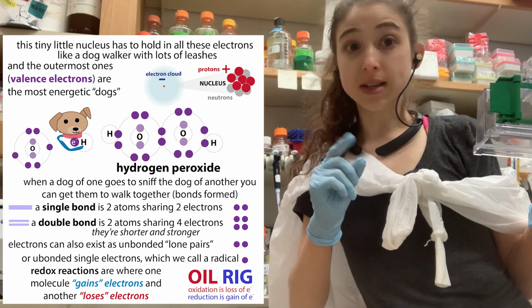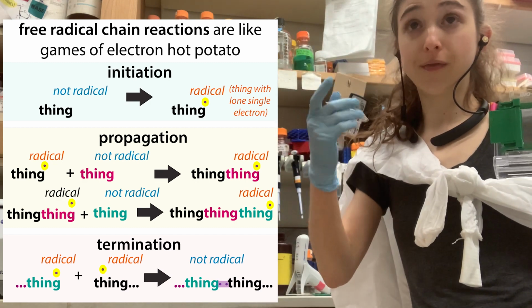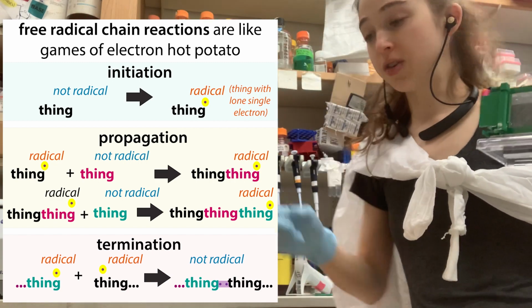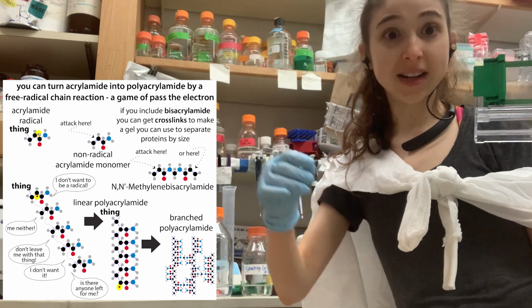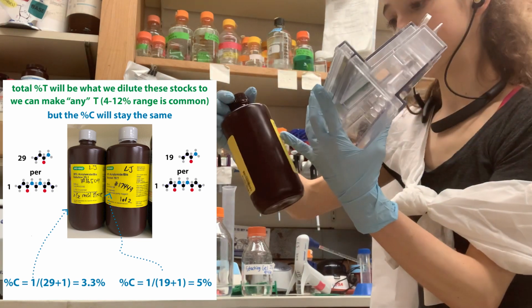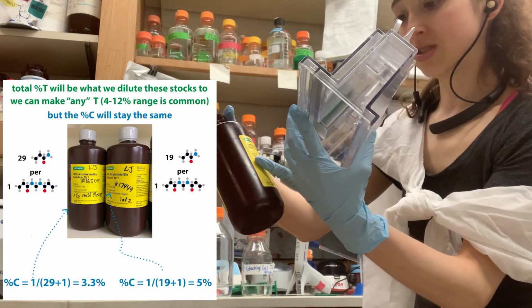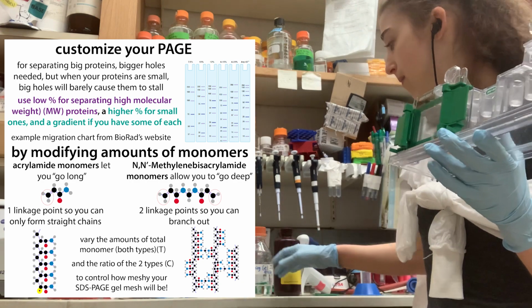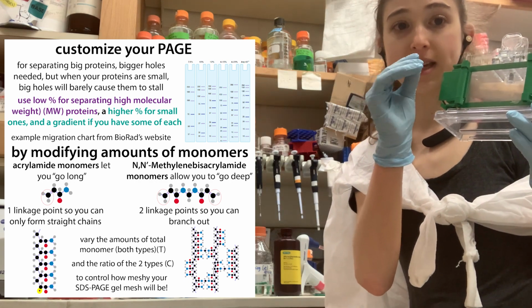So we call those molecules radicals, and they start off chain reactions because they're going to try to steal an electron from something else. They steal an electron from something, and then that thing is missing an electron and has a lone electron, so it's a radical. So it attacks something else, and you get these chain reactions. And when it's attacking these acrylamide, you get these chains. It's an acrylamide bis solution, like 29:1, so it has bisacrylamide, which forms cross links between the different chains. Varying the percentage of that is another way you can change the amount of mesh. You can imagine if you have more cross links, you might have a tighter mesh.